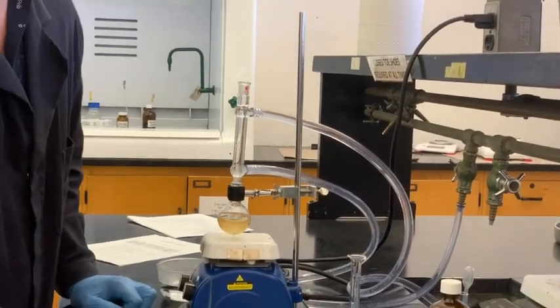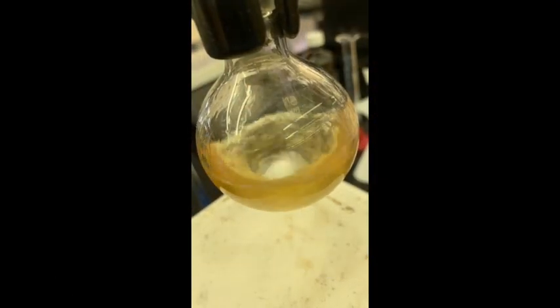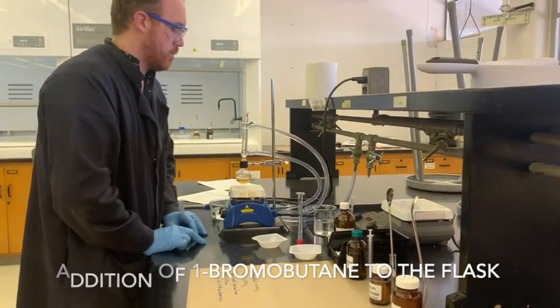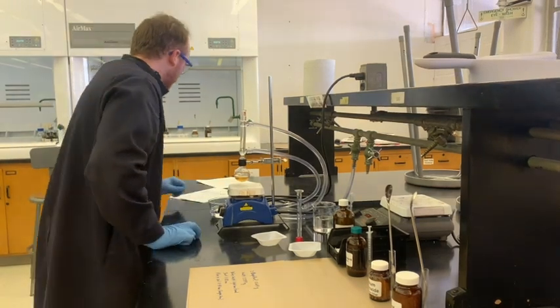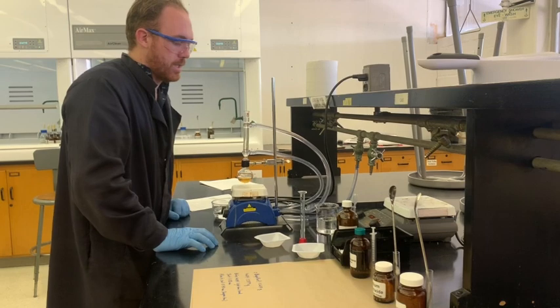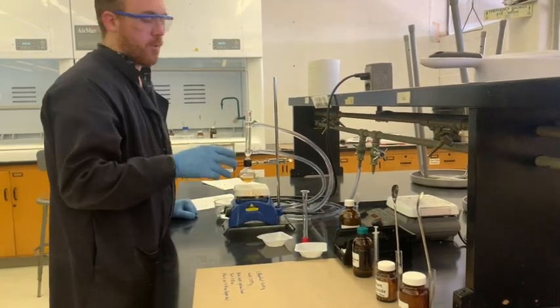In this case, bromobutane. So I've allowed this to cool for about 10 minutes. It is a little bit later than I would like to be, but that's fine. The temperature of this reaction is definitely below 60. I put a slightly cool DI water bath around it.